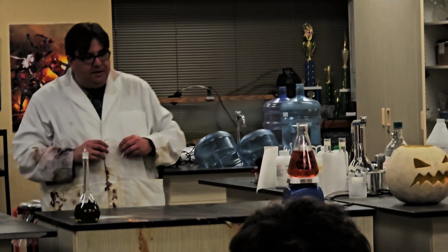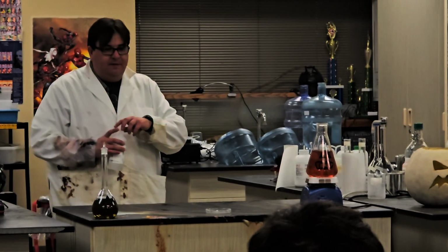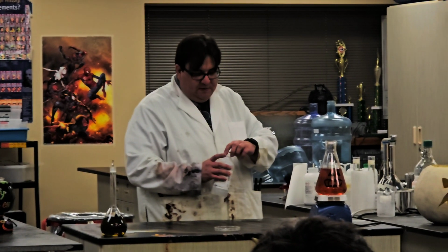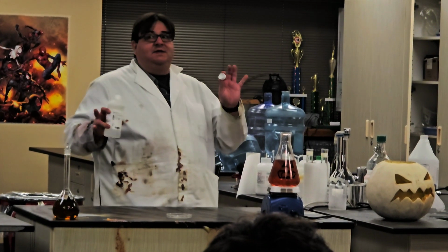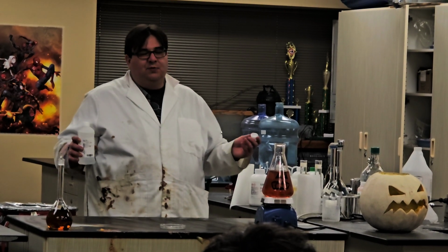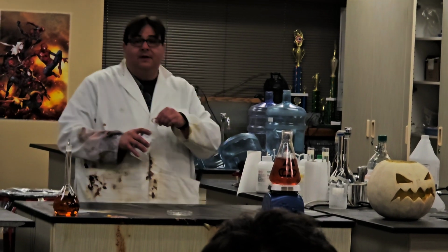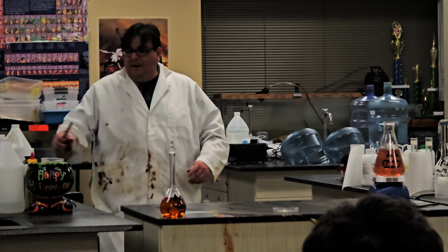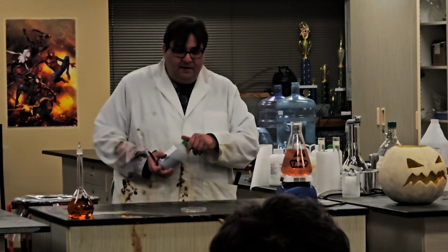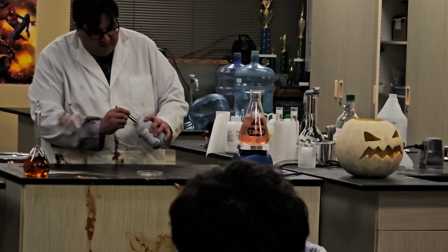And while those two are doing their thing, we'll set up another little experiment here. One of the things that always happens in movies and shows is they're always like, if I mix these things together, am I going to start a fire or blow something up? It's actually really hard to do in chemistry. Most things are not flammable. Most things are not explodable. So it's actually a very difficult and rare thing to do. But this one is one of the rare occasions where by mixing these things together, you can get that.